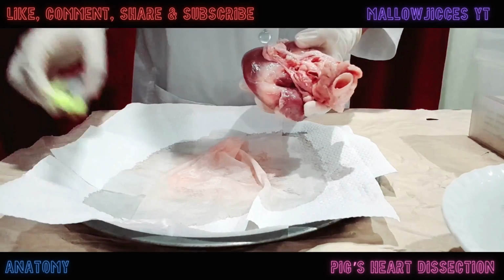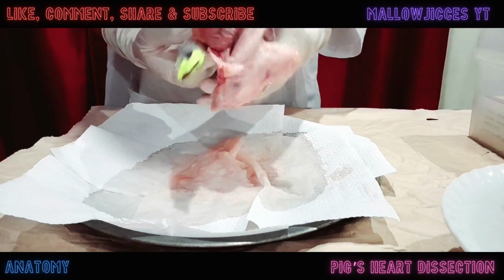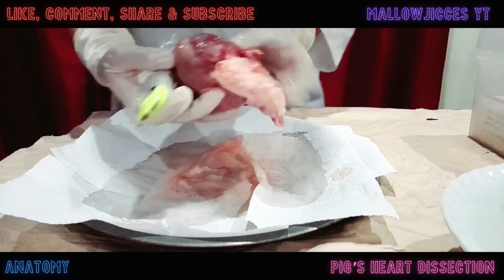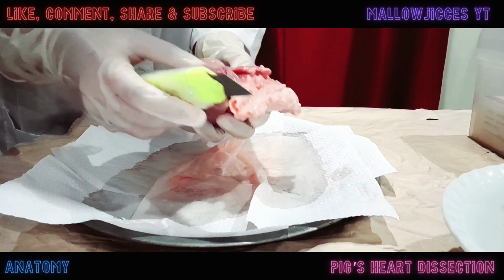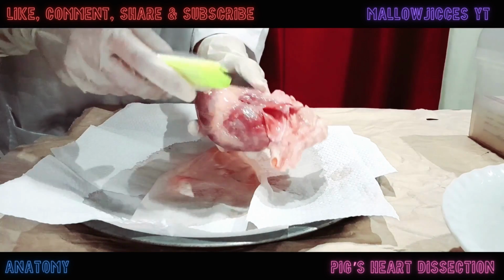Now that I have determined the external parts of the pig's heart, it is time to dissect it by making a cut around the perimeter, from the vena cava to the pulmonary vein.